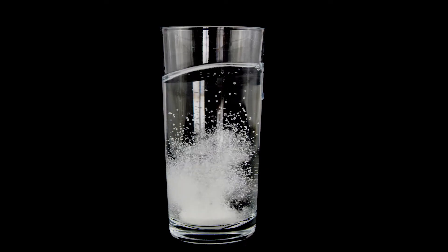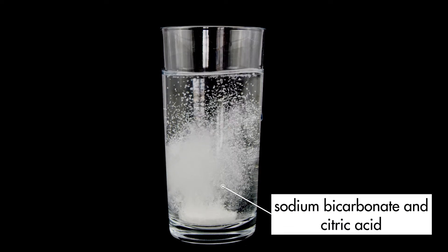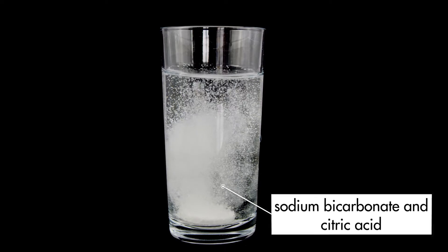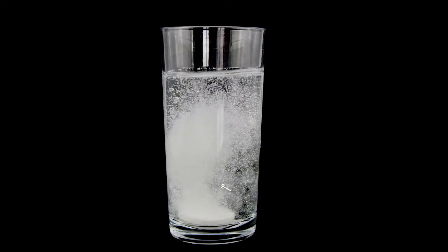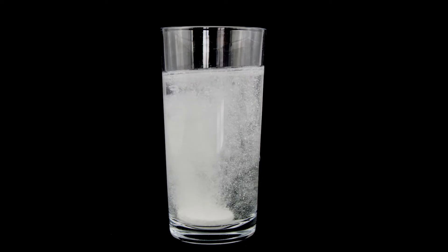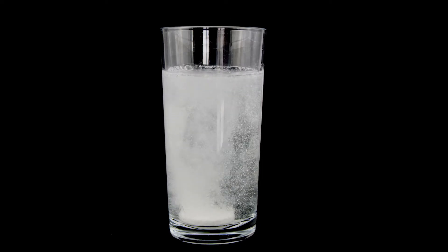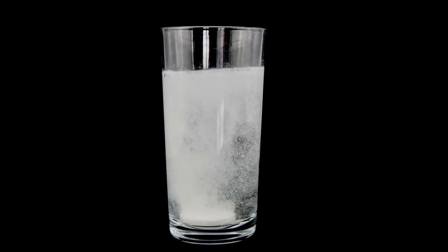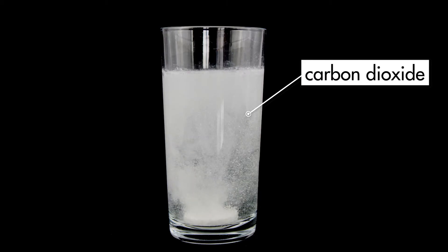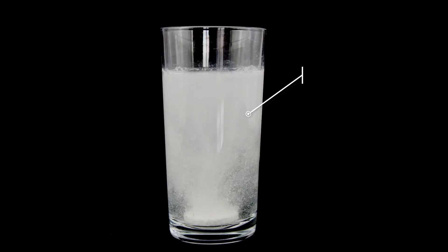The effervescent tablet contains sodium bicarbonate and citric acid. When the tablet begins to dissolve in water, the two chemicals mix and react. A byproduct of this reaction is carbon dioxide, which forms bubbles in the water.